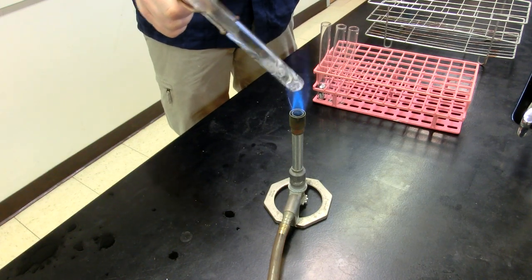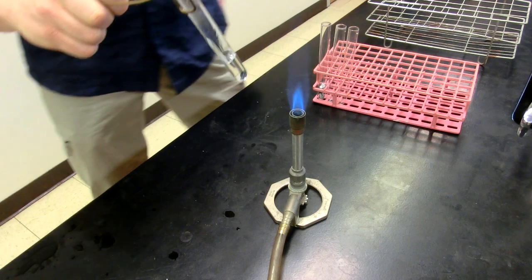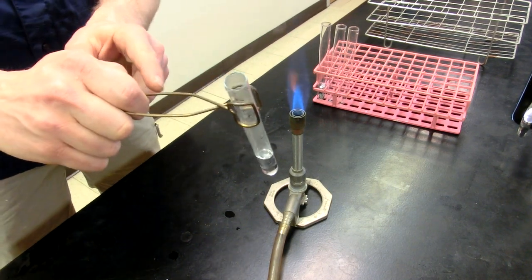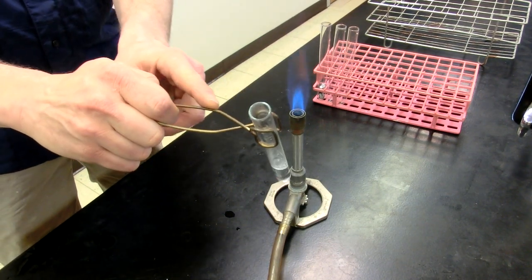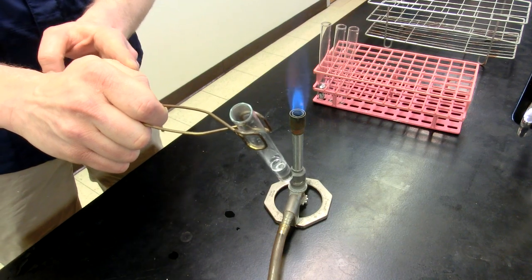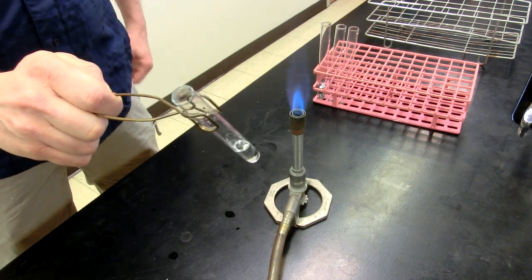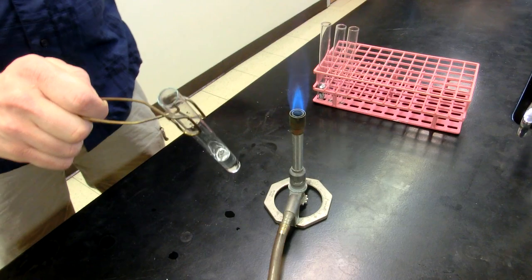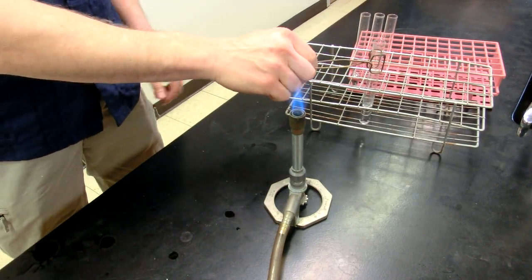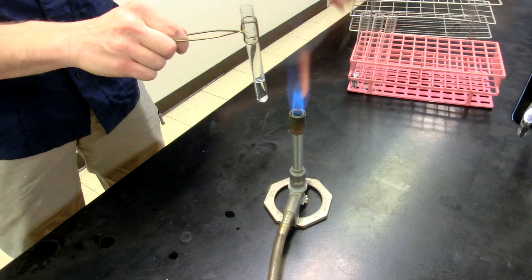But you'll notice that if you go to heat this, you'll be able to move it around pretty quickly. When this is boiling, I actually am able to feel the vibrations through this metal and I can feel it getting ready to boil. All right, now I'm going to put this hot test tube into the metal test tube rack or I could put it into the plastic one. I believe these plastic test tube racks are actually designed to handle the heat.